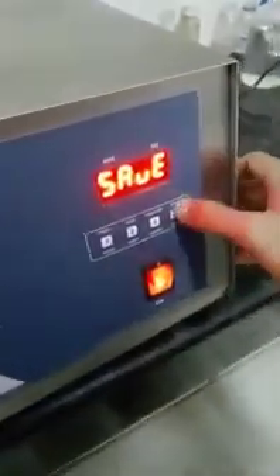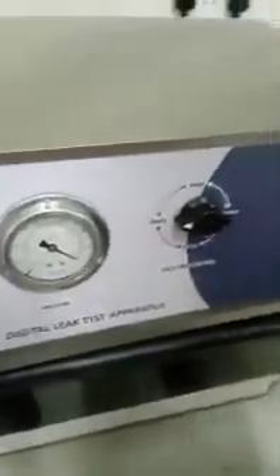We have to save it. The save and set are the same. Now we have saved our setup. This knob is for applying pressure — applying vacuum, holding the vacuum, purging the vacuum, and releasing the vacuum. Now we have put it in for applying vacuum.